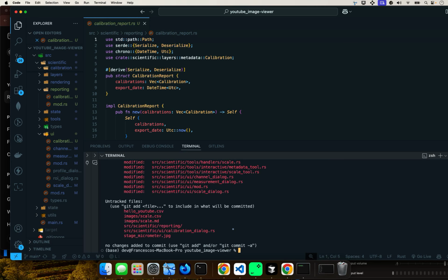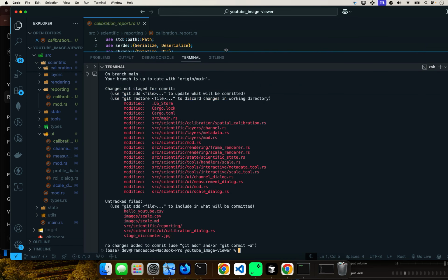This is just to give you an example of all the files that have been modified. They were not modified by a lot, just a little. I'm going to put this in the GitHub so you can do a git diff and look at the differences of what was modified.